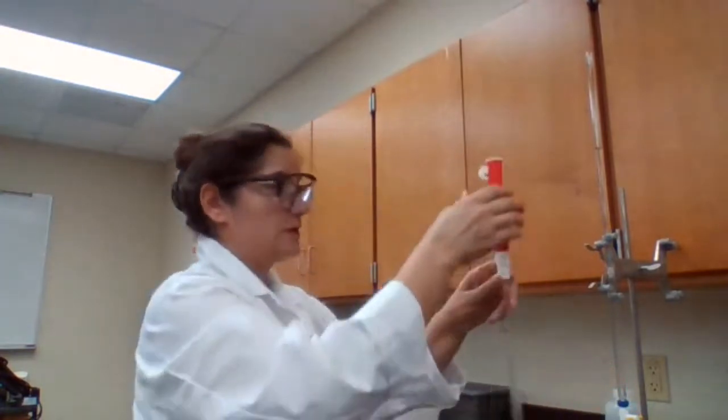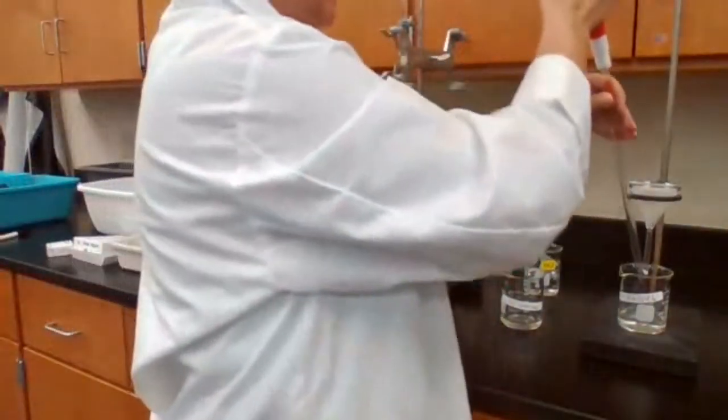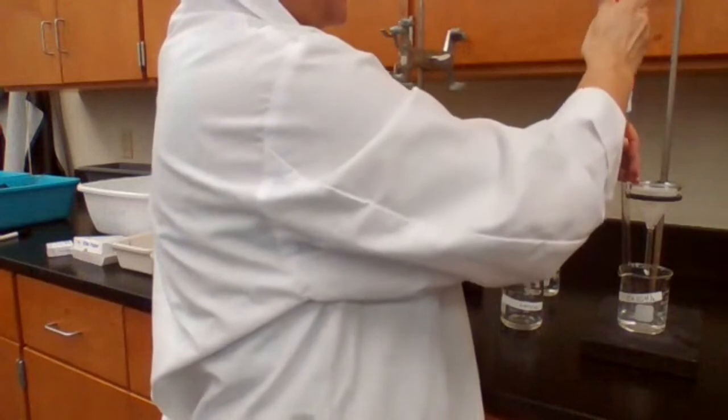So this is at room temperature. I will have to do a trial 2. For titration, you can never do one trial at room temperature. So for the second trial, they left me enough flask. Okay. Going to take 10 milliliters more of the calcium hydroxide.